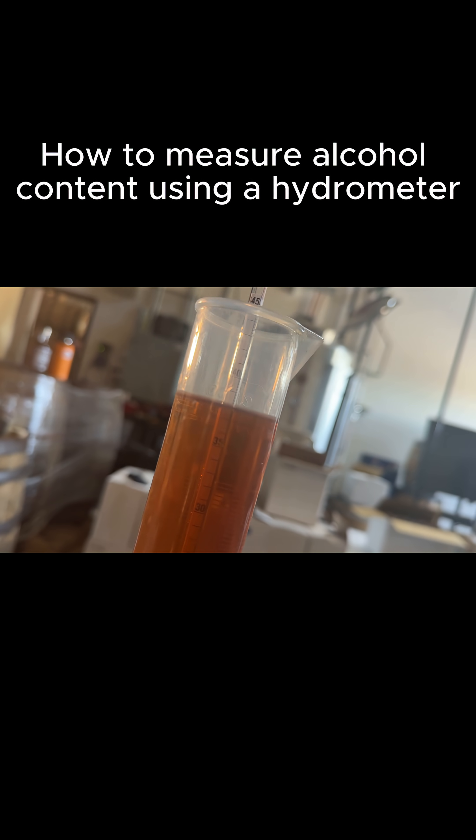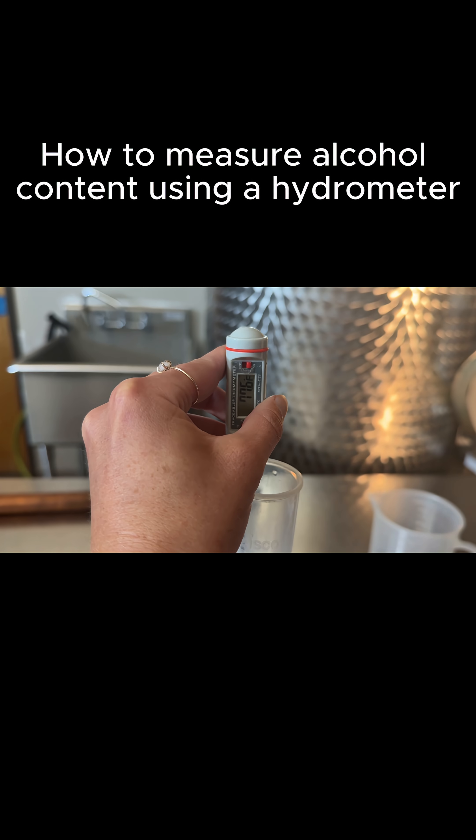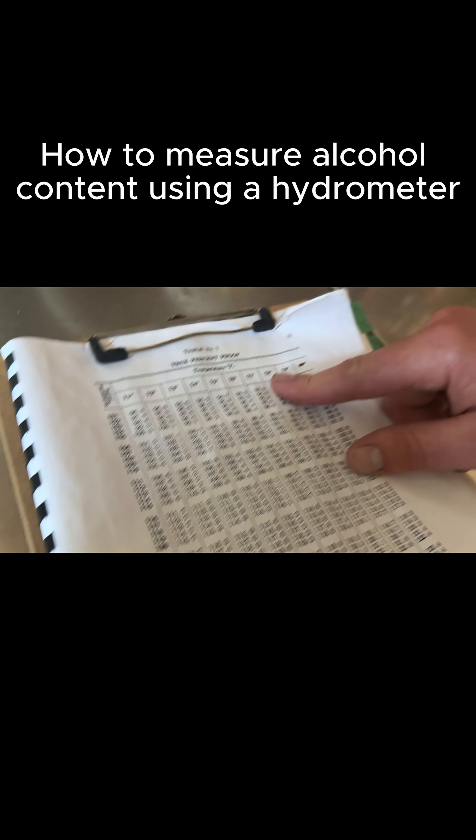138 on the dot. And this is just an initial proofing — 178 at 138.